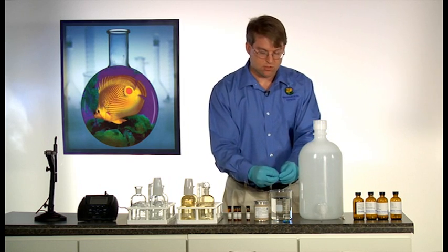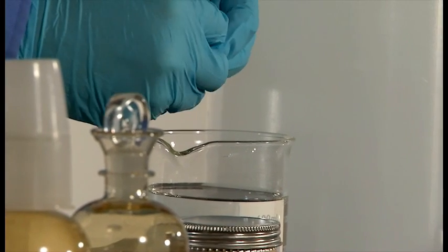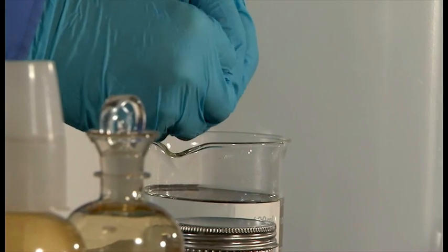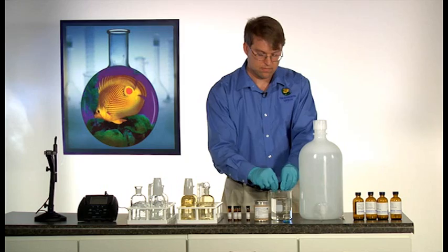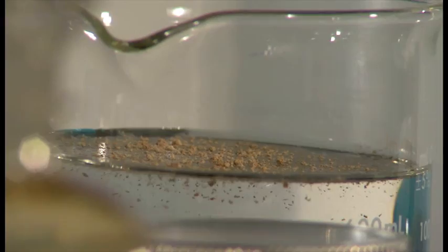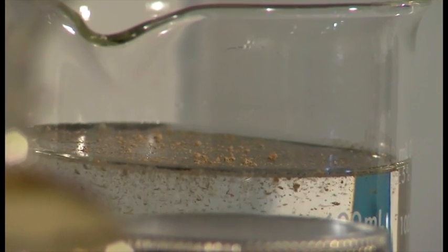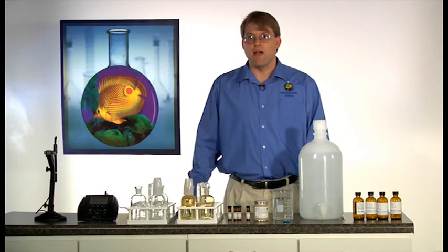Simply place the contents of one capsule into 500 milliliters of your dilution water. More or less water can be used to adjust the strength of the seed as needed. Stir or aerate the seed for one hour.